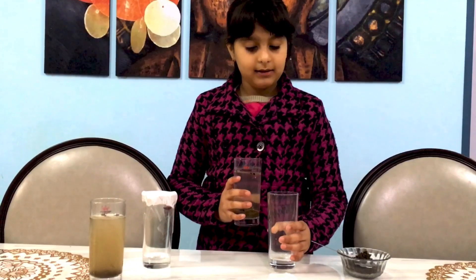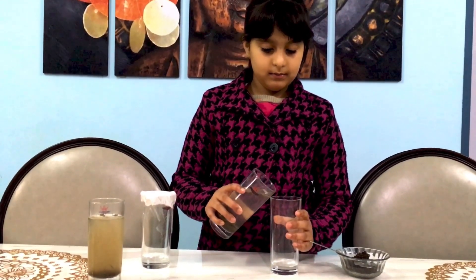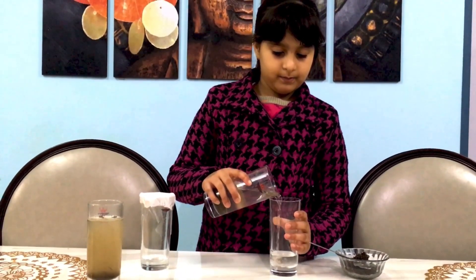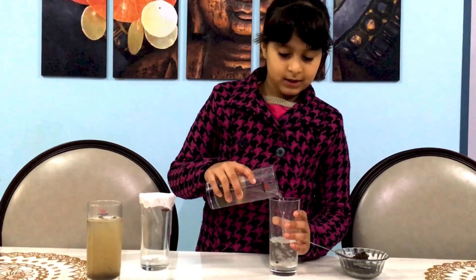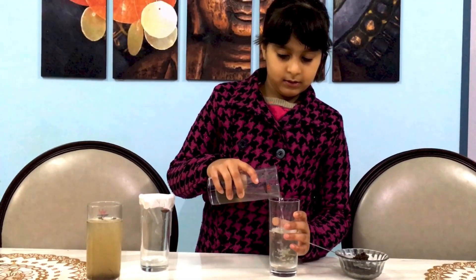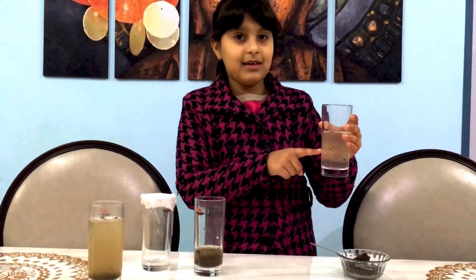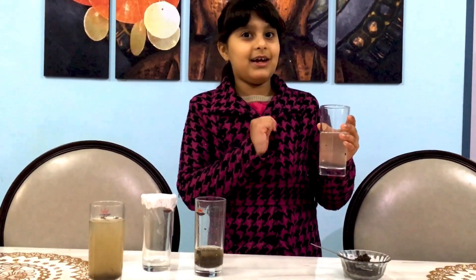So let's come to our next process which is decantation. Now here we will take another glass and we will pour the supernatant liquid gently into another glass without shaking it. Now here you can see the water is cleaner than the first one.